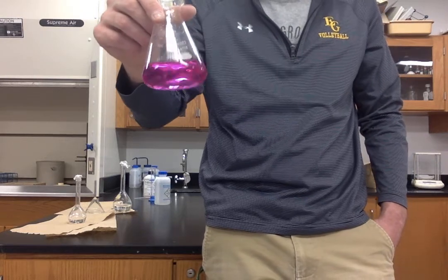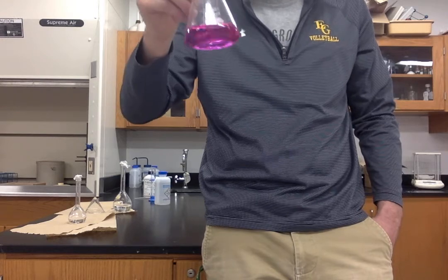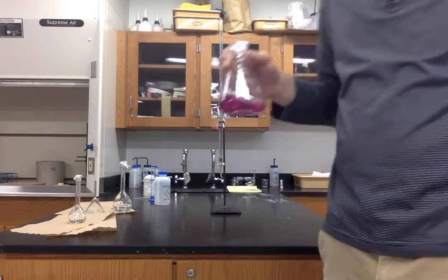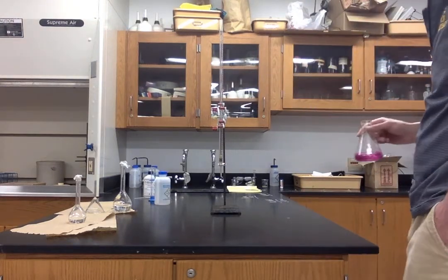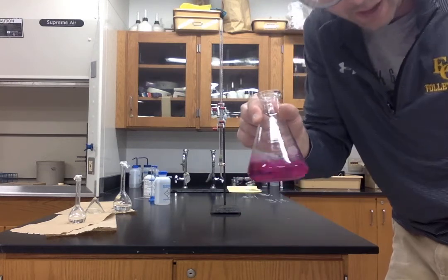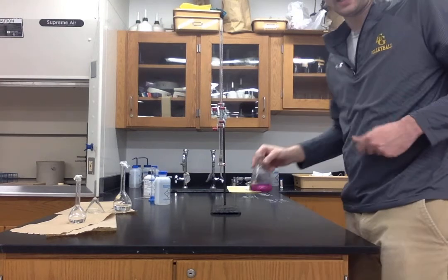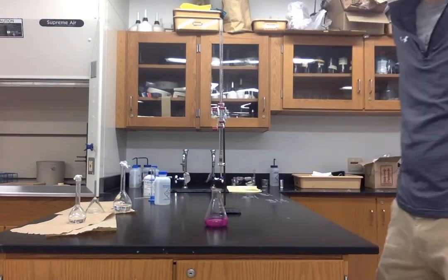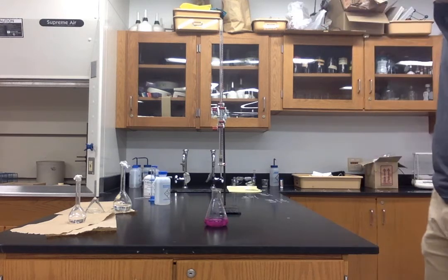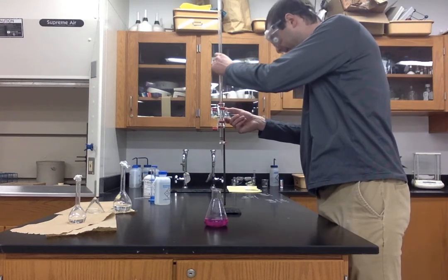What you are looking for here is an extremely faint pink solution. We have a dark pink solution. Now, as I was being very careful, I do know that I overshot literally by one drop of sodium hydroxide. So we're going to use this data. Be aware, it is slightly too much, and we can talk about that in the error analysis section, in terms of how that will impact our results. Now, what we need to do here is take a final volume of sodium hydroxide.